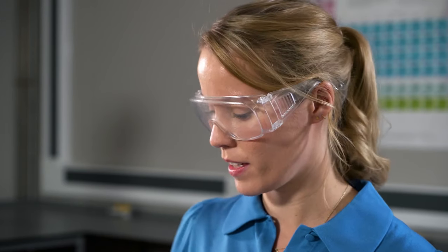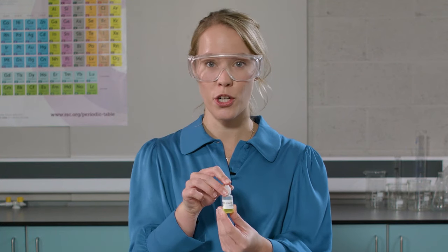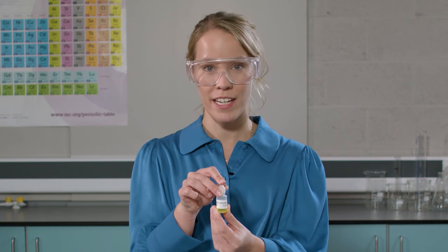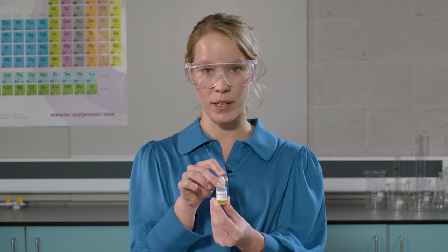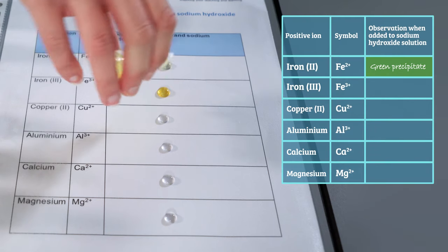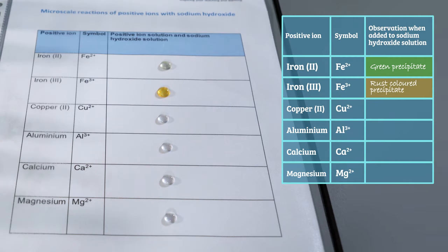We can record our observation in a results table. I'm now going to work my way through the positive ion solutions. As you work, try to think about what is happening in each reaction. I'm going to start with the iron(III) solution. Iron(III) is different to iron(II) because iron(III) has lost three electrons instead of two electrons. Just be careful as you are dropping the drops onto the paper that you don't spill any.